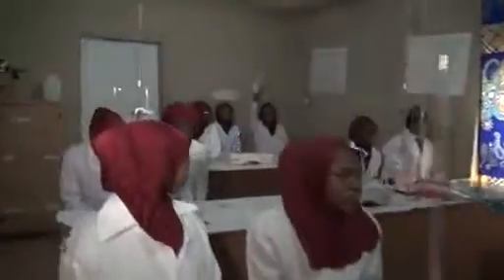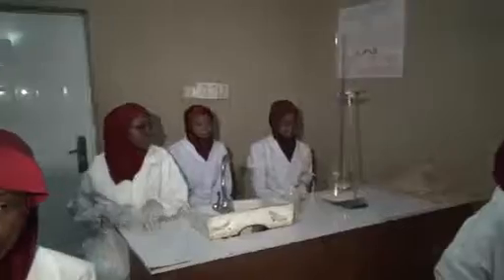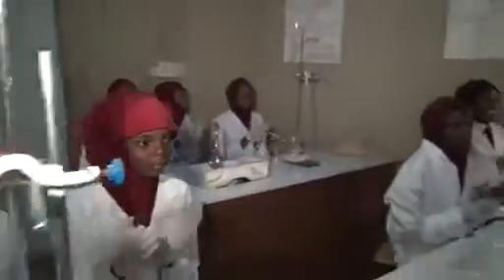Do we still have another precaution? Yes, Barabi? Take the readings at eye level. Clap for her. Fancy, yes? Avoid water bubbles when you are pipetting and when you are titrating. Where are you avoiding the bubbles? In your burette and your pipette. Is it water bubbles? No, air bubbles. Air bubbles. Clap for her.